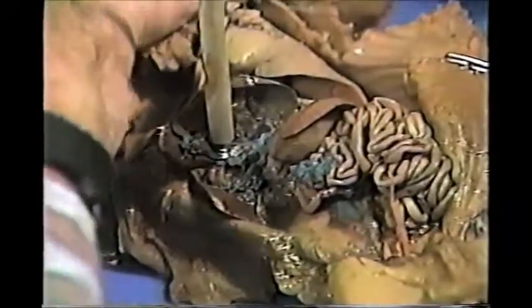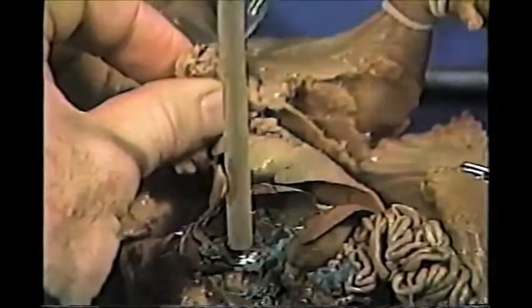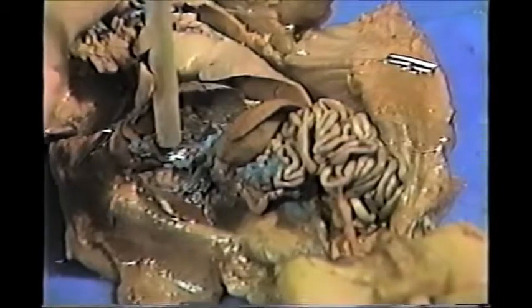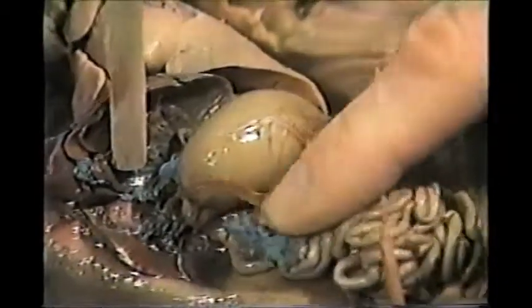We're going to take the liver and pin it back using a probe, and I'm going to take my tube and stick it down the esophagus, which is right behind the larynx, and I'm going to try to blow up the stomach. So if the camera could focus down here at the stomach, and I'm going to try to pump some air in. There it is. Now I can really blow this up like a balloon. Don't overinflate it because it will pop.